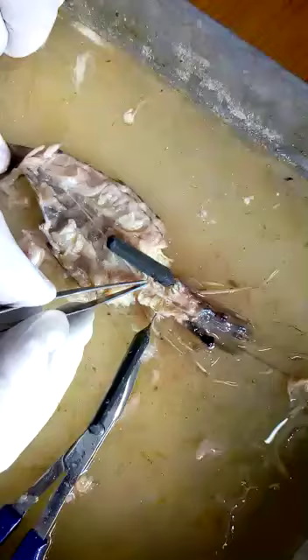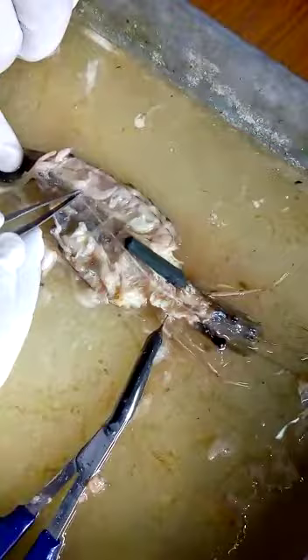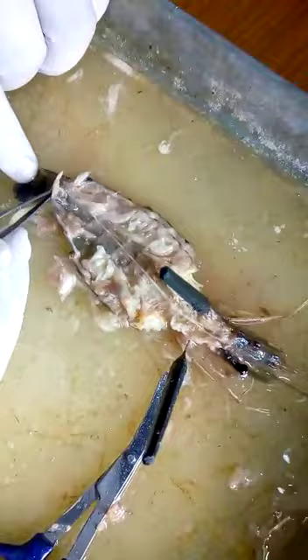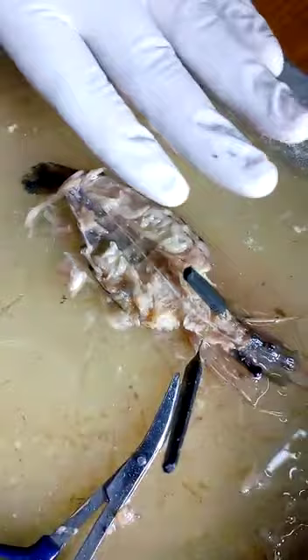This is the ventral nerve cord. In the ventral nerve cord there are one, two, three, four, five, six ganglia — also present here. The six ganglia are visible. This is the ventral nerve cord, and this is an important system.